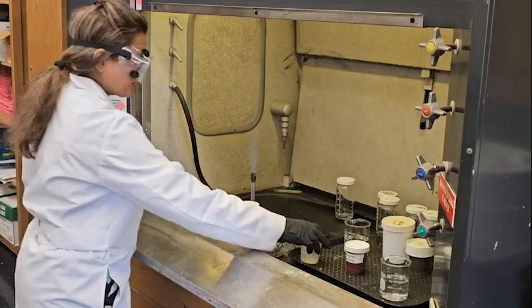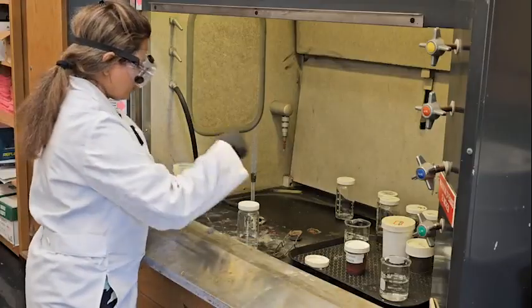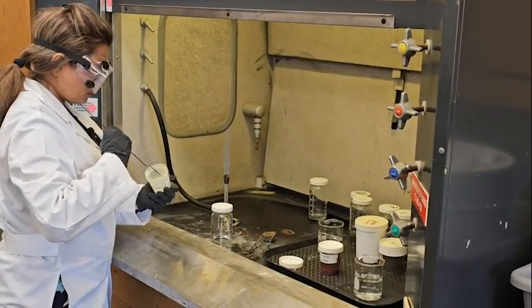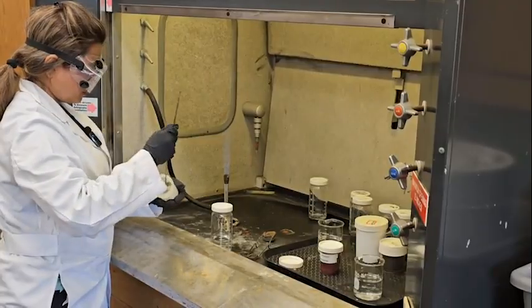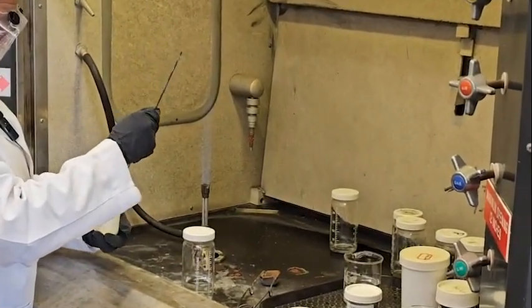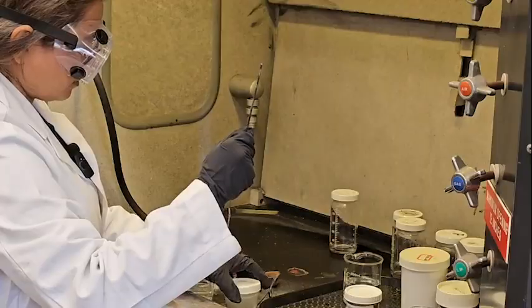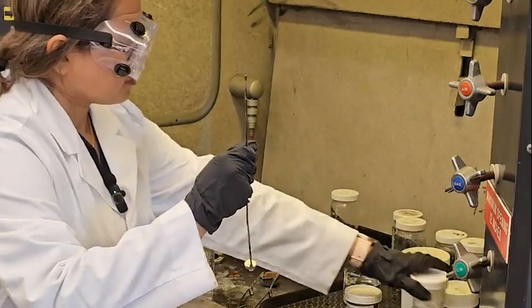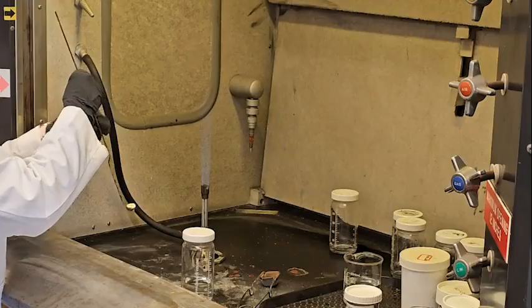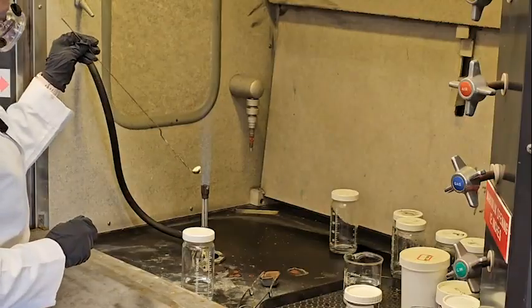First we take sulfur. When you burn it, make sure you are all the way up.